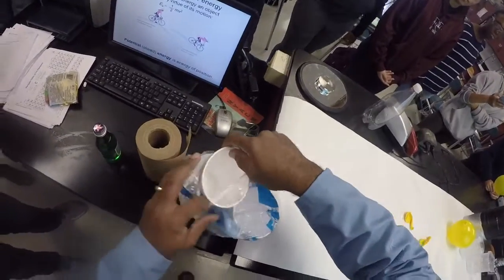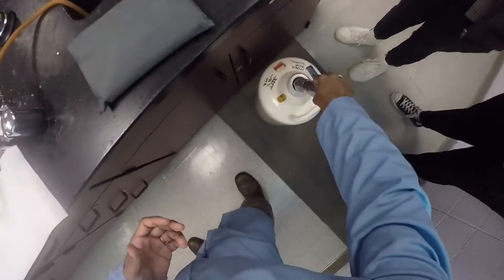By the way, you might notice the thing I pulled out of the door is this, and this is not a top by any means. You are literally not allowed to transport liquid nitrogen with something that will seal. Can you guess why? It can explode. Pressure can build inside of this container. I had to drive from New Jersey with this in the back of my car.